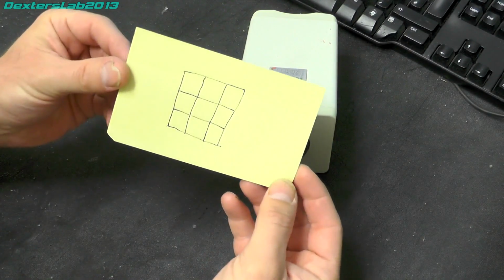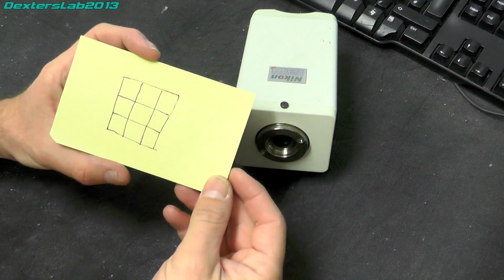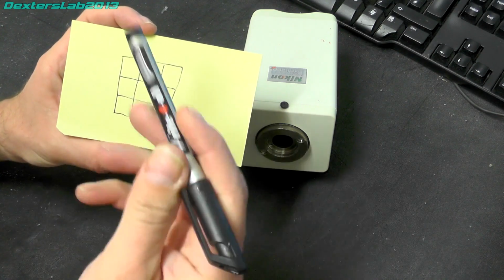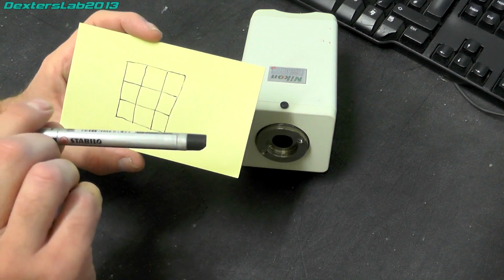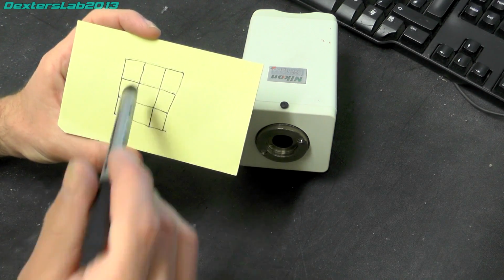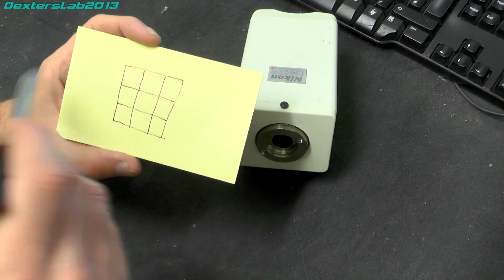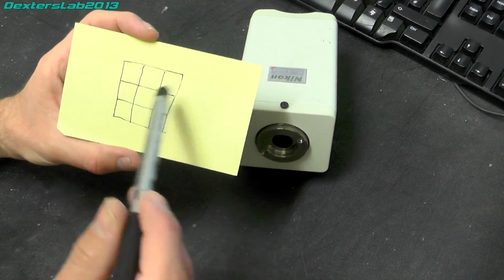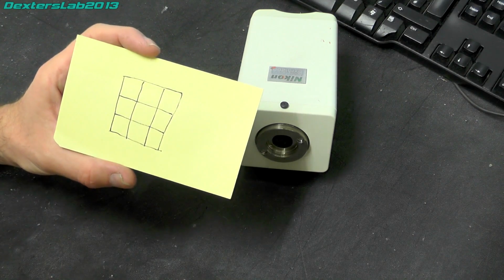So if we just look at this little grid, which represents one whole of the picture elements of the CCD. Now what they're saying is they've got an actuator which allows them to move the CCD left, right, up and down. So in its default position, it'll take a sample here, and then there'll be some kind of actuator which pulls the CCD that way. And then that allows you to take a different image of the actual whatever the light's coming through the lens, and you take 9 pictures. So you've got the center position, and then 1, 2, 3, 4, 5, 6, 7, 8 to give you 9 in total, and you interpolate all those together to give you a 12 megapixel image.